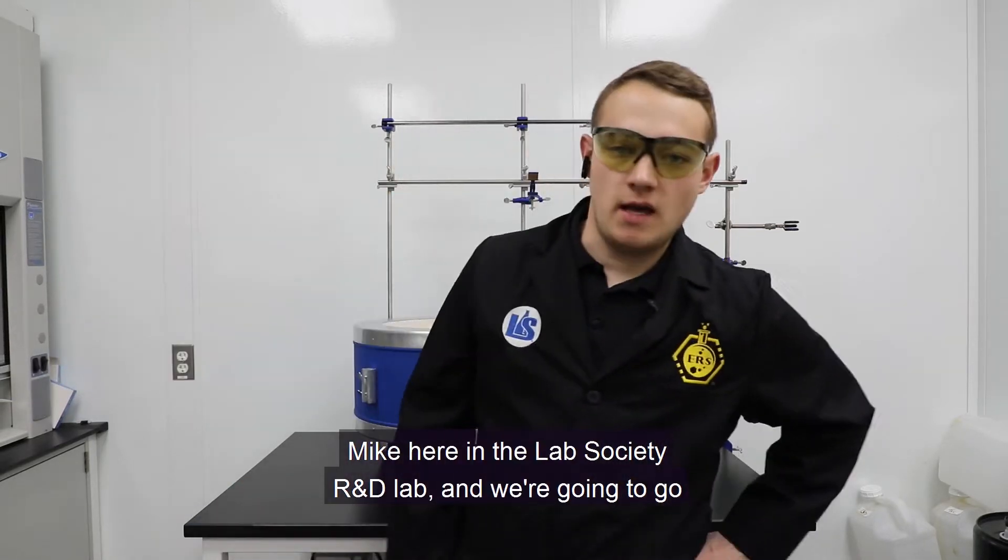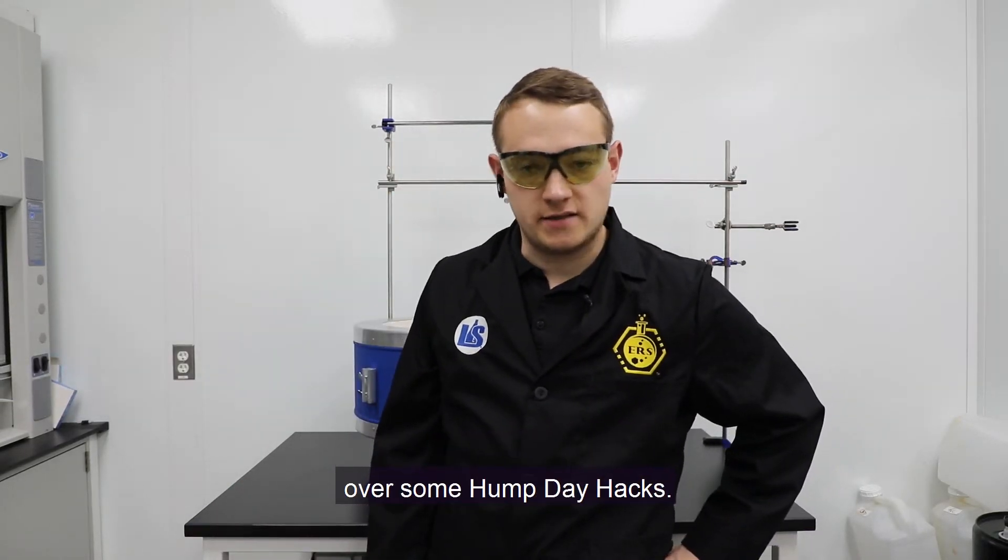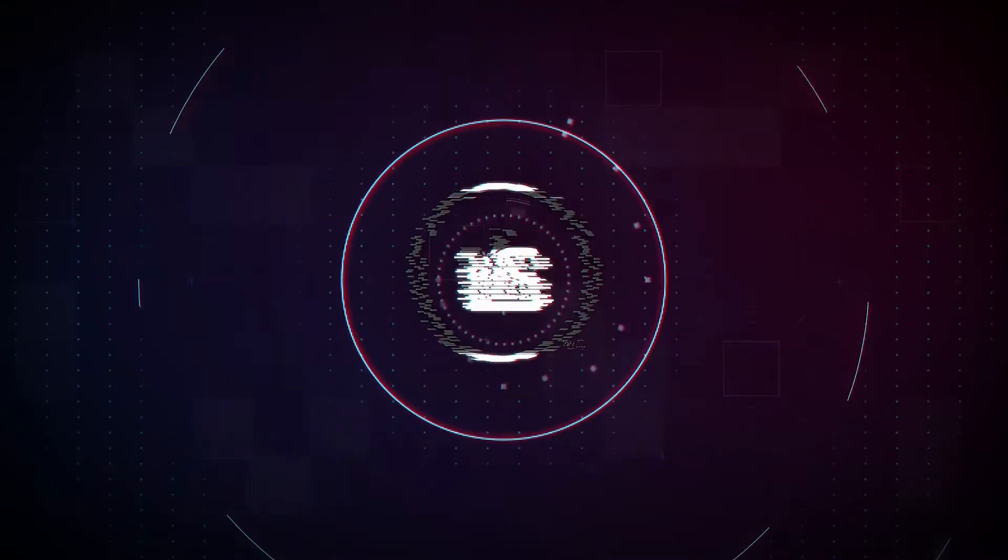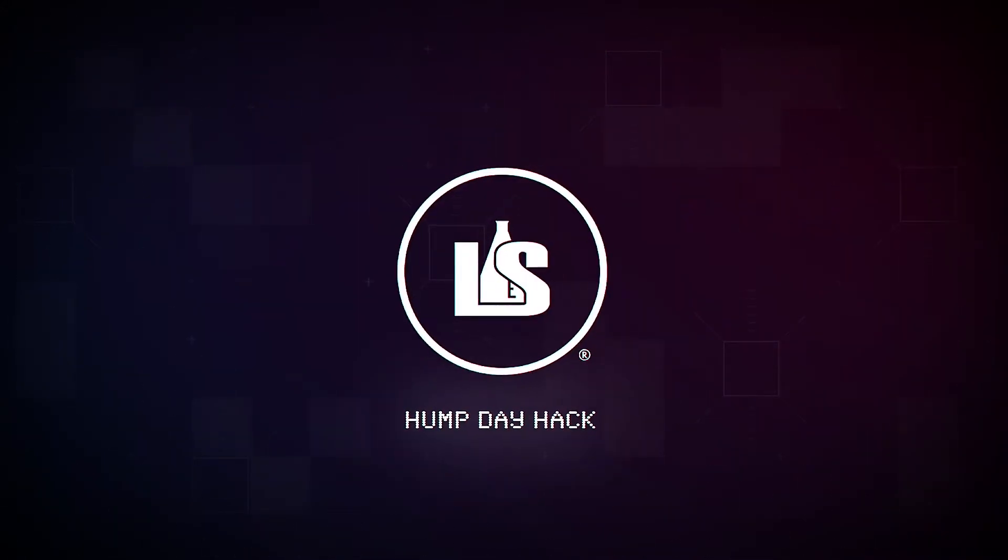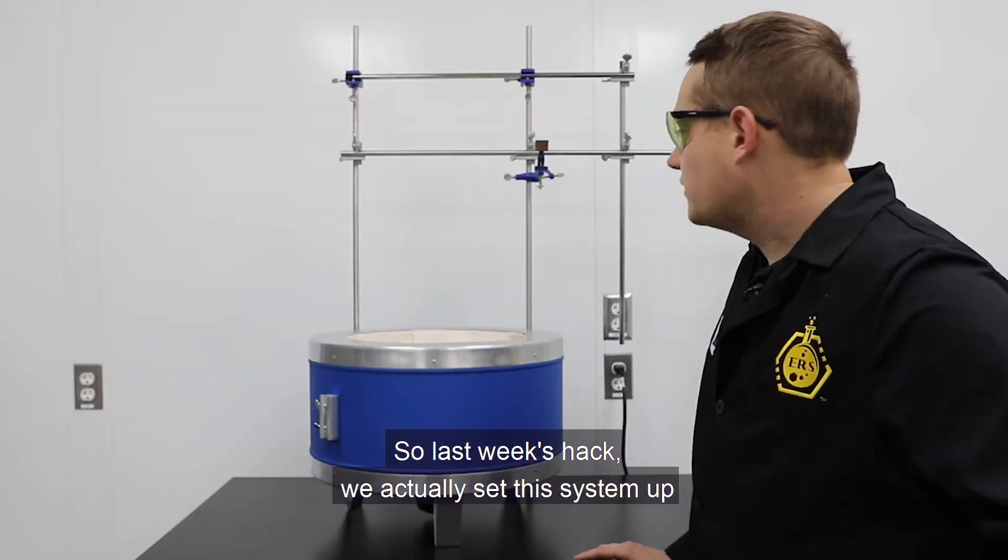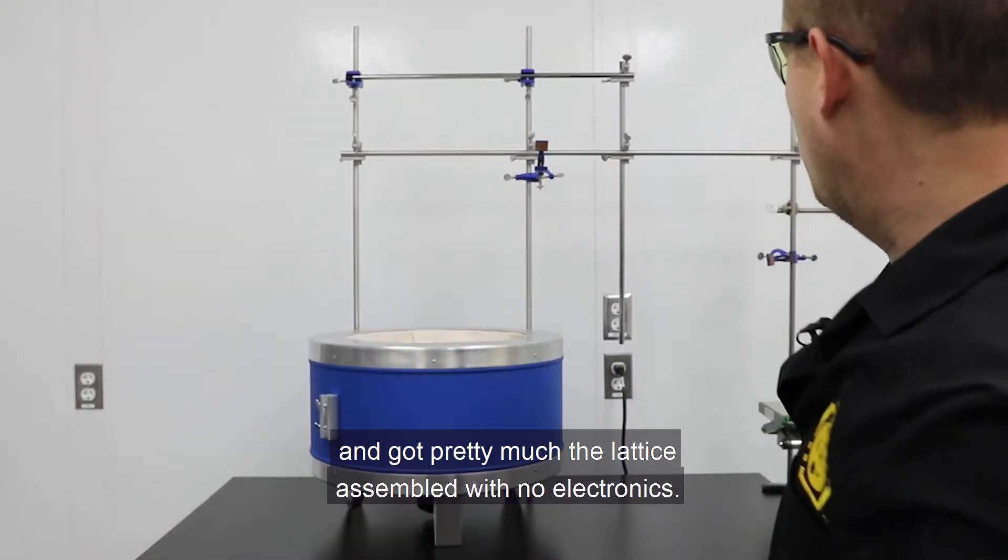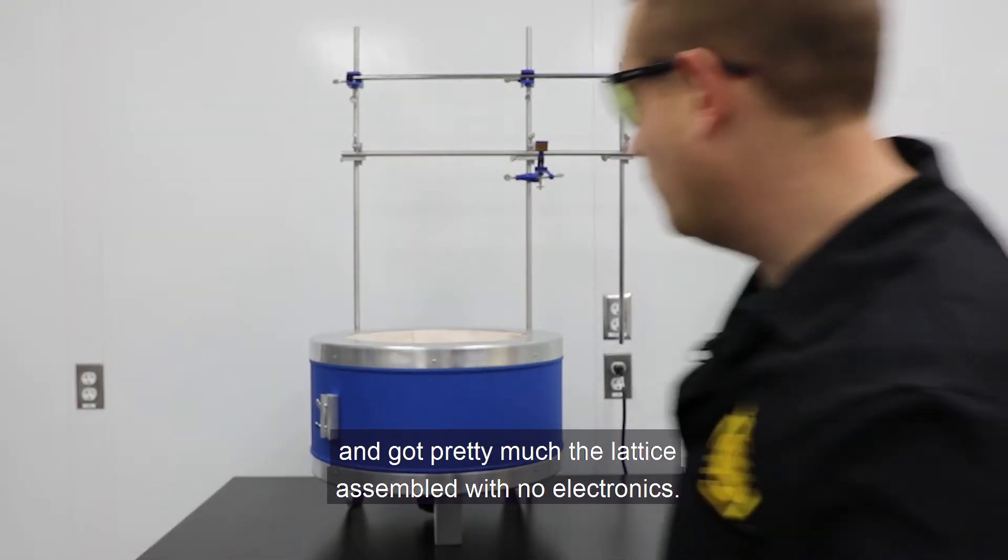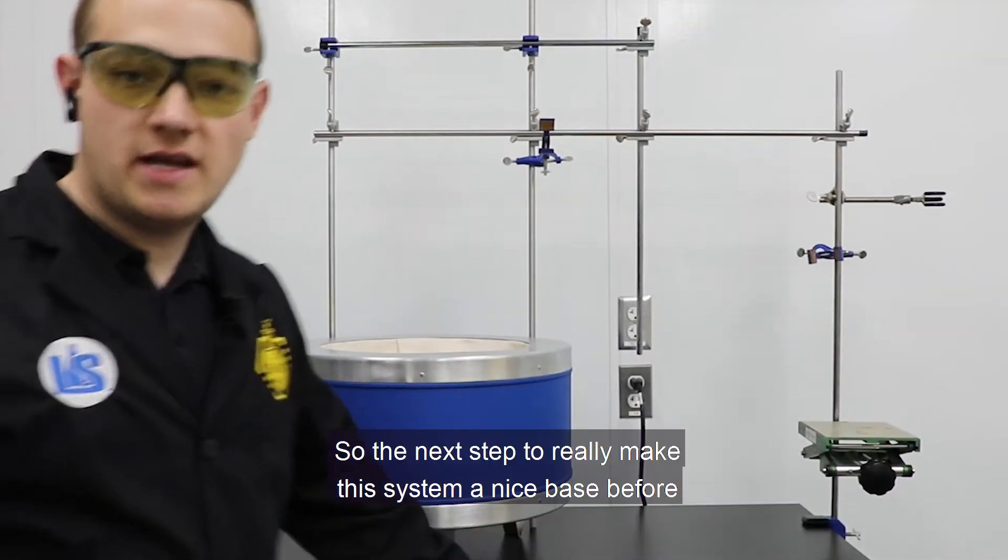Mike here in the Lab Society R&D Lab and we're going to go over some hump day hacks. So last week's hack, we actually set this system up and got pretty much the lattice assembled with no electronics.